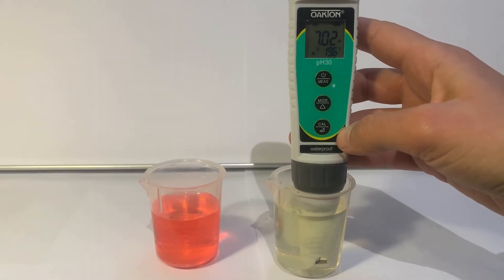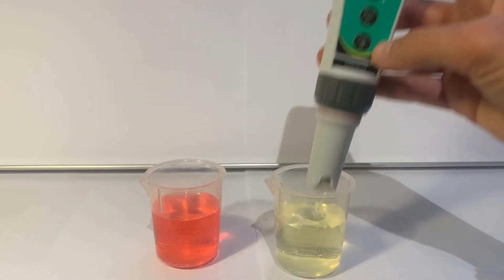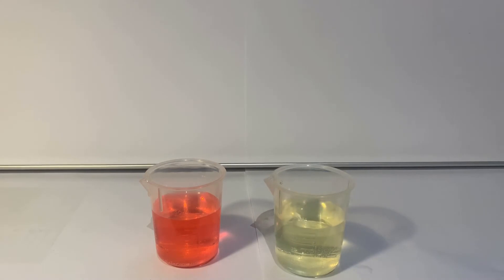Take out your meter, rinse it thoroughly with water, and repeat this process in your next calibration solution.